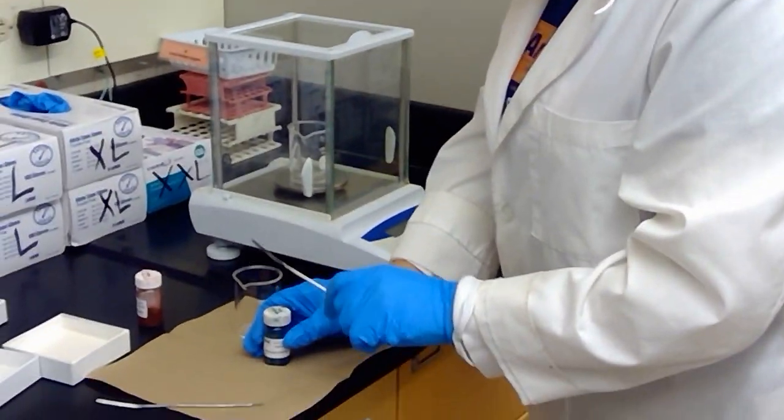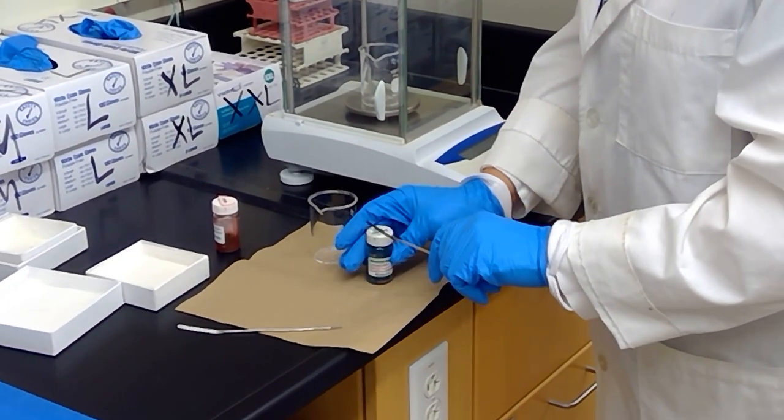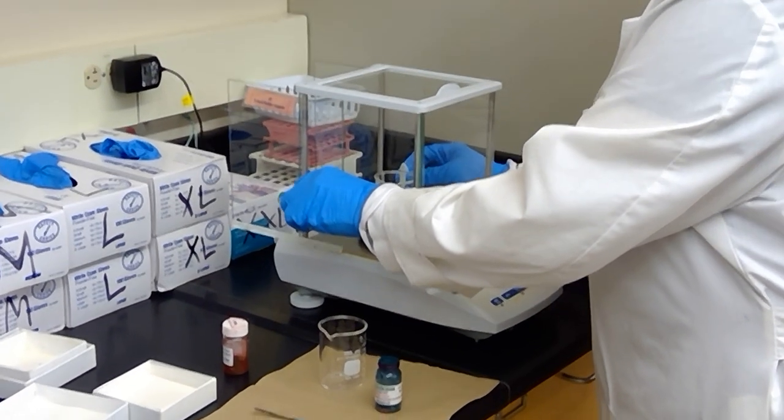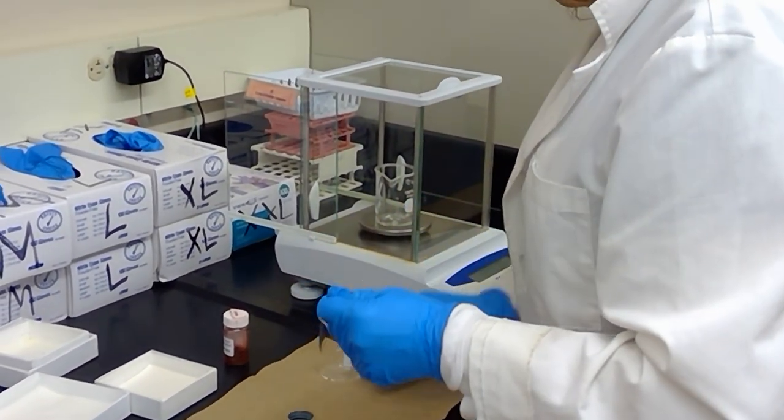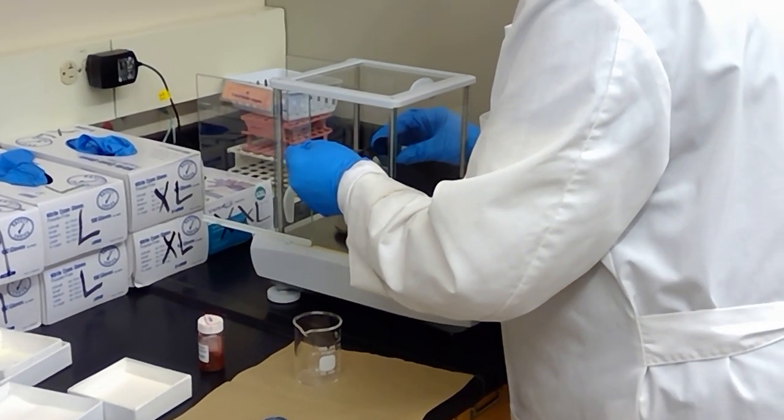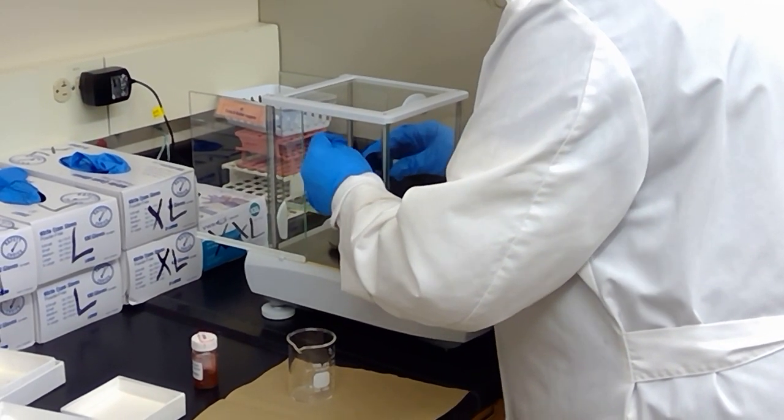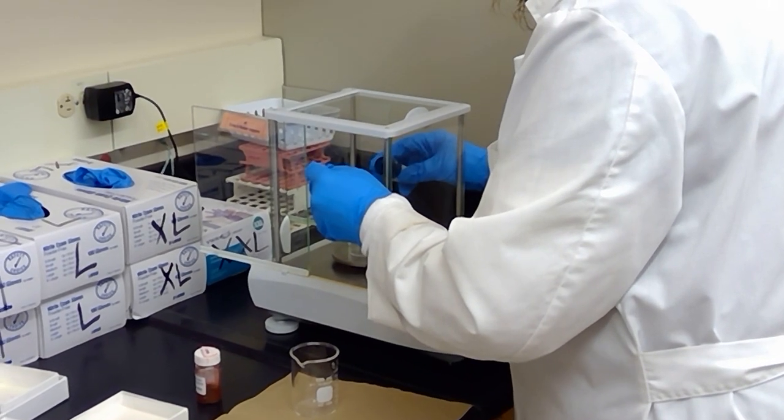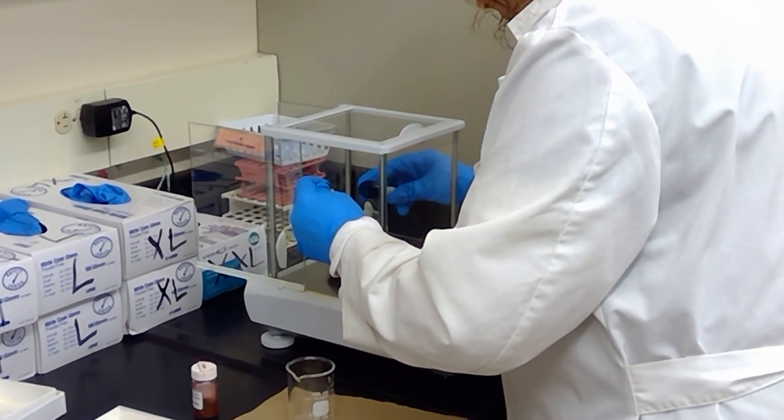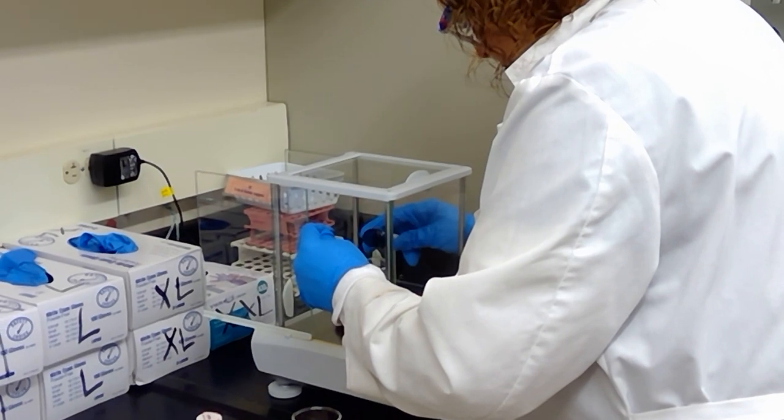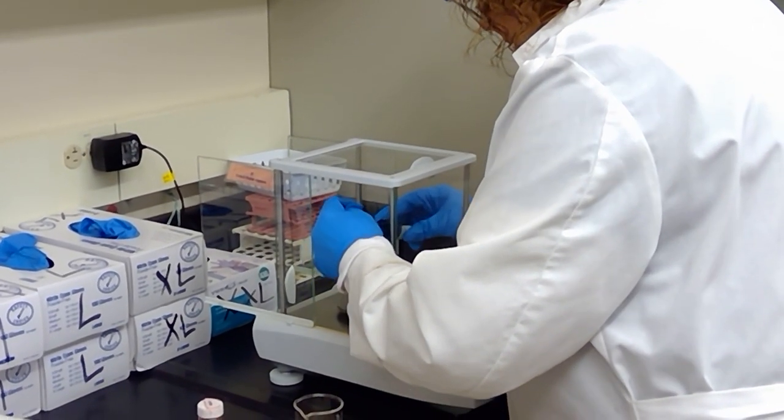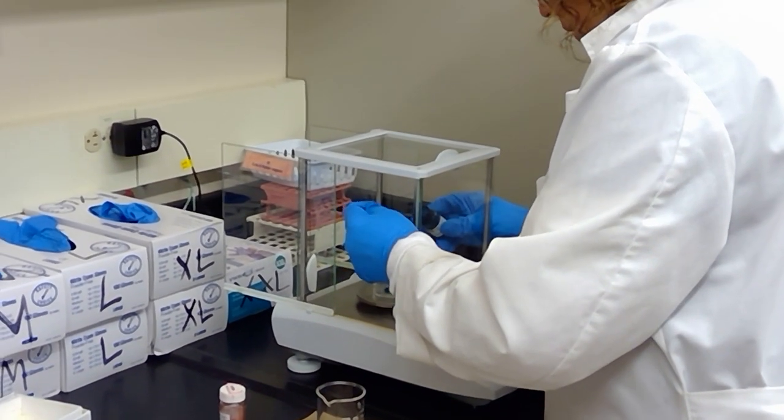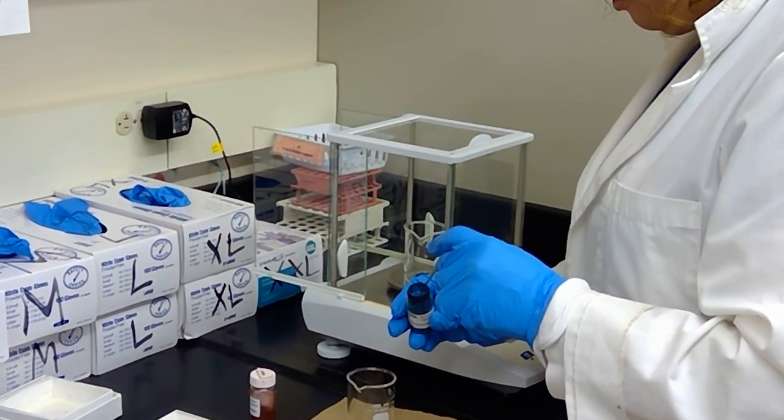Because this component is not the most safe, I'm going to tap down the cap to make sure that we don't have any compound that's going to pop up on me as I open the container. The goal is 20 milligrams, or 0.02. Okay, we are very close here. Looks like we've made it. Here I have 0.023 grams of malachite green into my beaker.